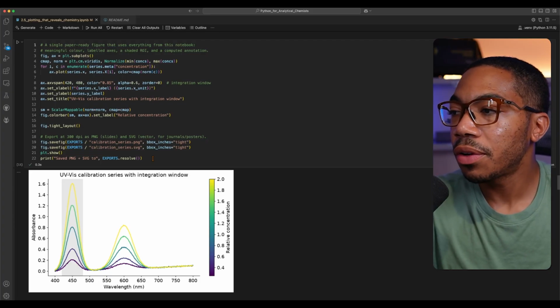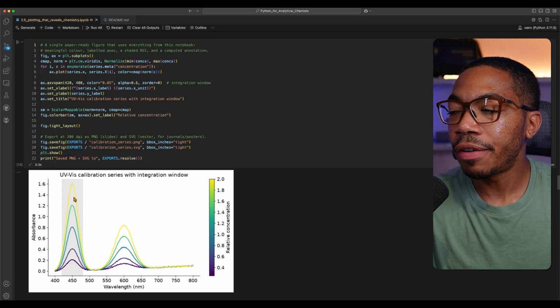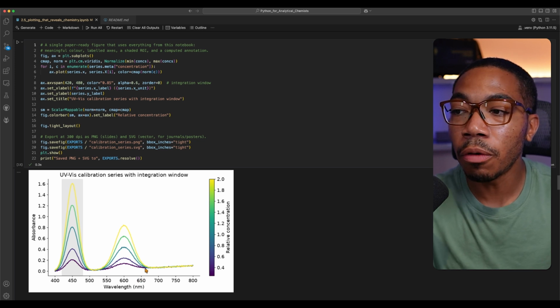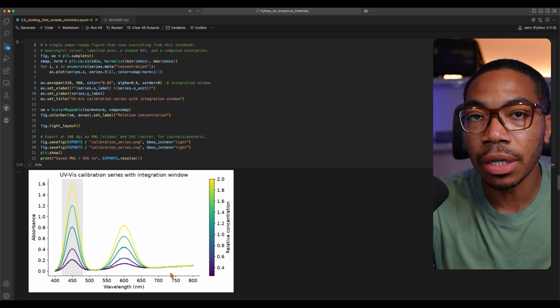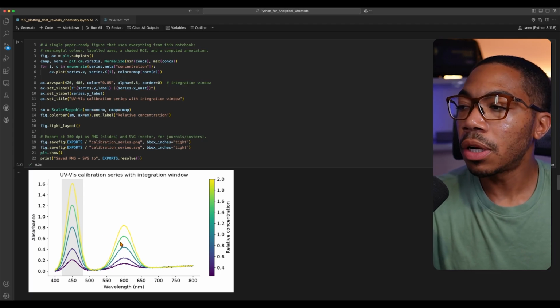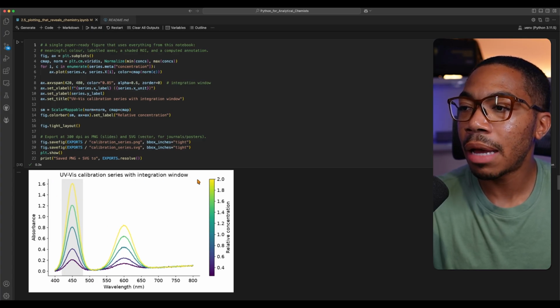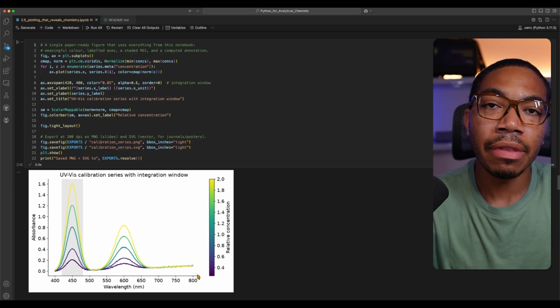So if you look at this next figure, you can see it looks a little bit different than the one I showed you before. We have the shaded region. We have our viridis color map. The resolution on this figure is a tad bit higher than the one I showed you earlier in the notebook, and the font is a bit bolder and larger, and this will look really good in a scientific journal. Furthermore, notice that there are no grid lines here to reduce any visual clutter, and we don't have that top and right vertical line there, just to make the figure look a bit cleaner. Admittedly, some of this is just stylistic preferences, but generally you want your figure to be as clutter-free as possible because we don't want to distract from the actual chemistry we're trying to reveal.